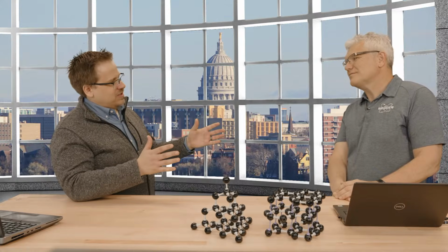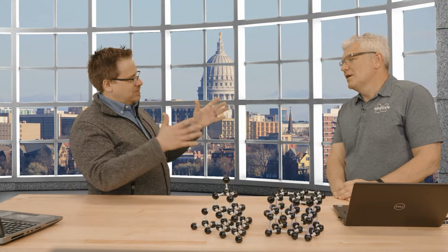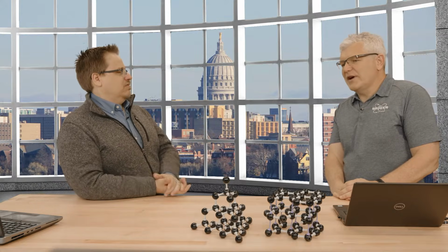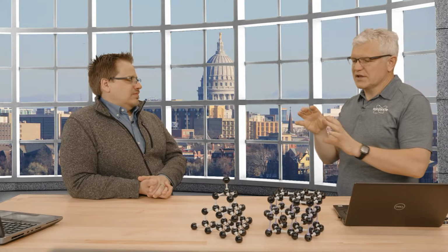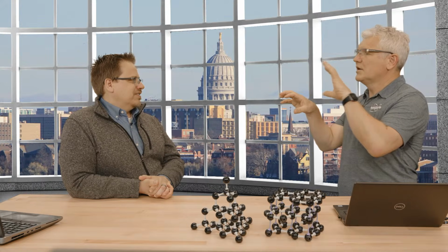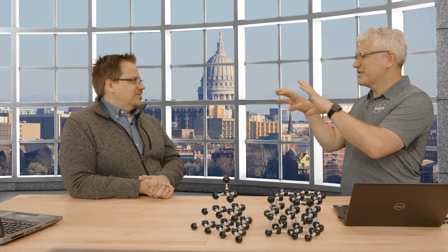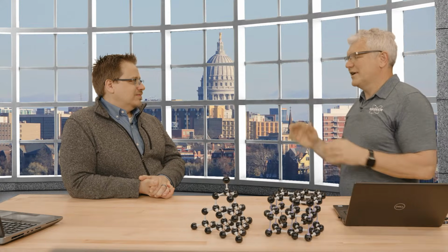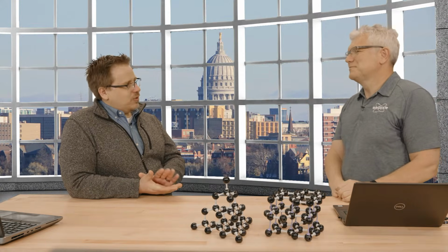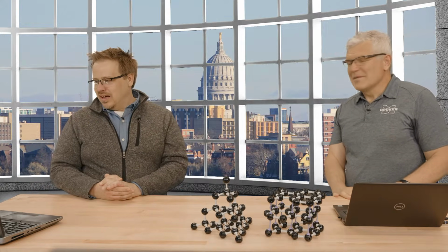So whole molecule disorder sounds like this big bin where you could put a lot of excuses, but I mean, that's not the case when you refine the structure, it really looks like there's whole molecule disorder. Right. Basically, what you see is you have your molecule, and then there's a little shadow of the molecule to the side, and the main molecule might be 80% or 90%, and then there's a little part of a shadow, close, but not quite right. Exactly. All right.